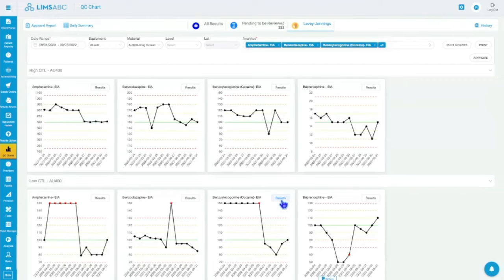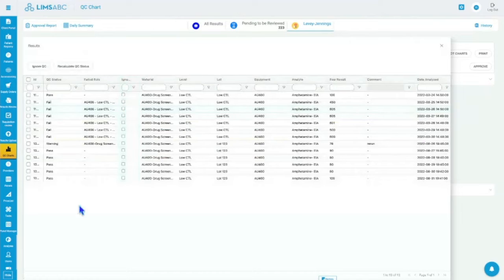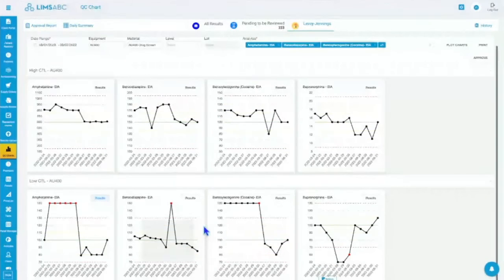So you can look at this one. This is definitely a problem. This is fine, right? So you can easily identify, and you can see the results if you need to. So if I want to see the results for this one, I can just hit results, and this brings me all of the results with the pass, with the failures. I see all of my failed results here, which are obviously these ones here at the top, right? So you can easily see all of your charts.